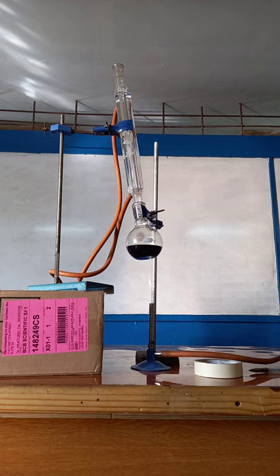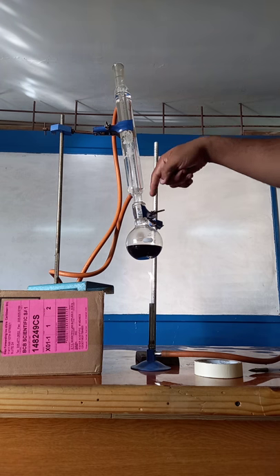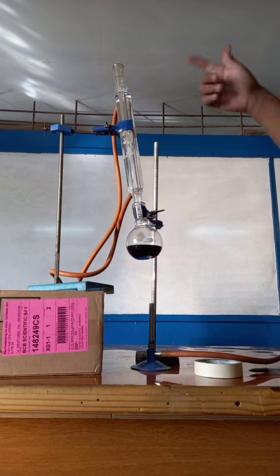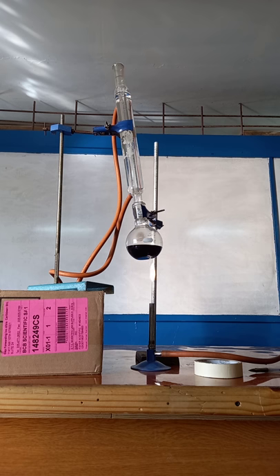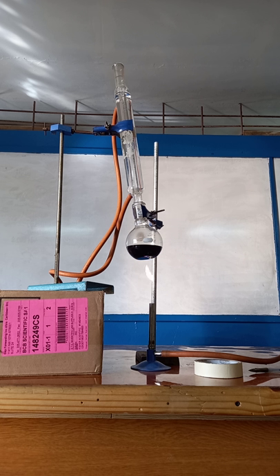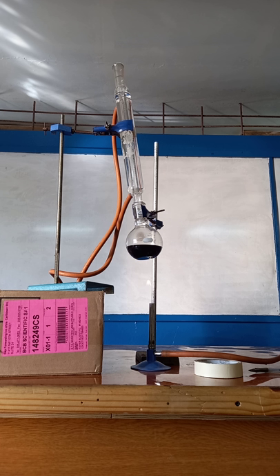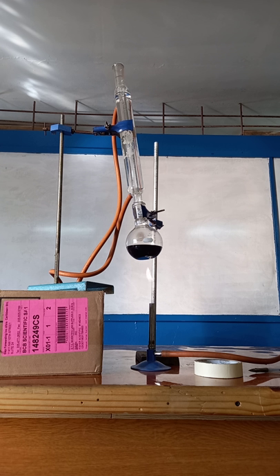That is how we set it up for reflux. The condenser is placed directly into the round bottom flask. Once it starts to evaporate, it will not be able to escape and so it will condense and fall back into the mixture. The aldehyde will be oxidized to the carboxylic acid. This is the setup for reflux versus distillation.